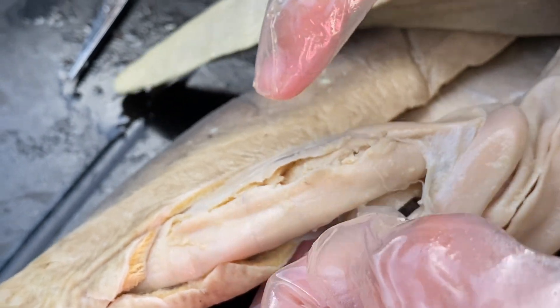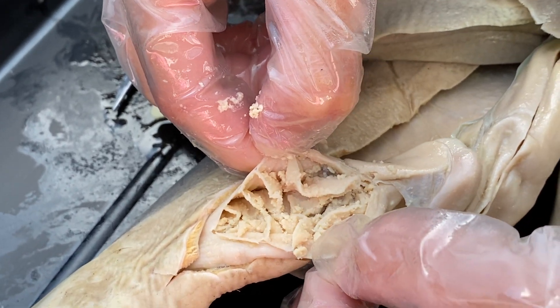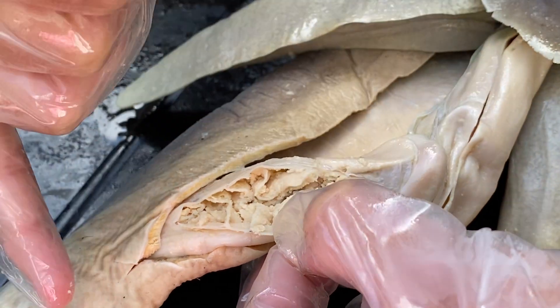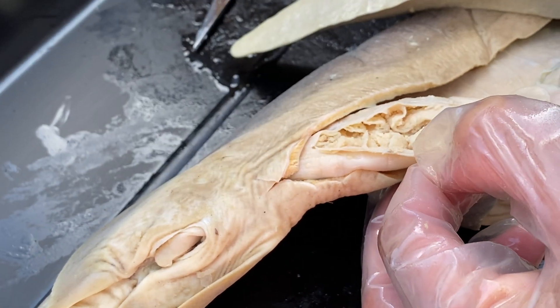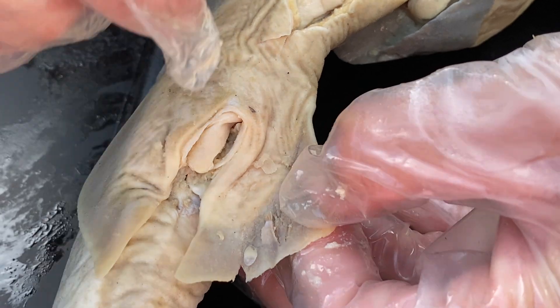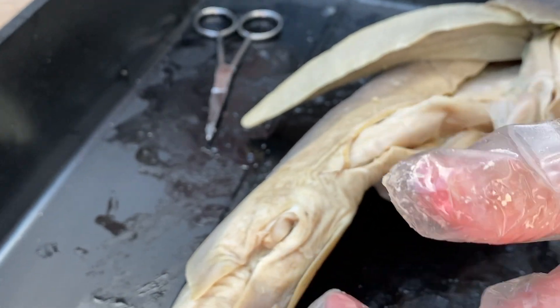This spiral valve literally makes the food do a spiral, like a spiral staircase, down through the intestines — increasing your surface area for absorption. At the point of the food getting to the spiral valve, it is pretty well chewed up and chemical digestion has occurred. Once it gets to the spiral valve, it's pretty gooey, like a smoothie, and this is where your real absorption actually occurs. So instead of it being a hollow tube and the food just shooting straight through and then getting excreted out of the cloaca, it takes a pretty slow journey with lots of absorption. And then finally, anything that is not absorbed comes out of the colon. The cloaca is the opening — the word cloaca actually means sewer. The colon, just like ours, is the ending of the digestive system, absorbing any last-minute salts and waters coming out of the shark.